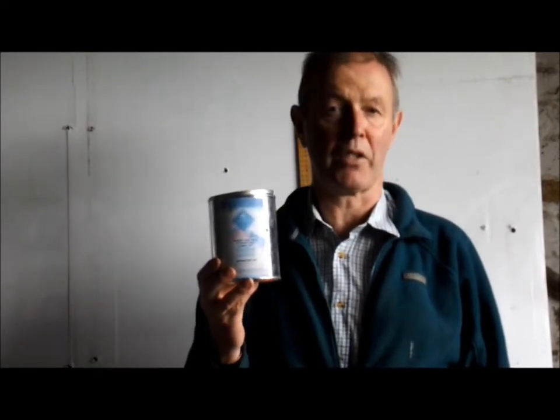Before you can do your test, you have to obtain some calcium carbide. This can be bought quite easily on eBay, about 1.5 kilos in a tin for around about 15 euros.